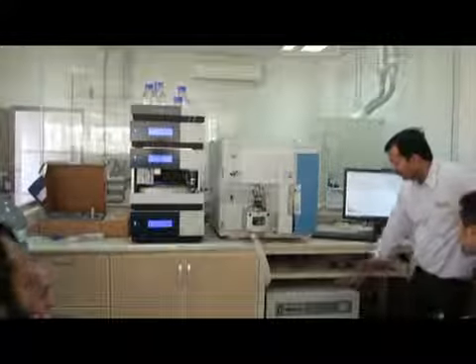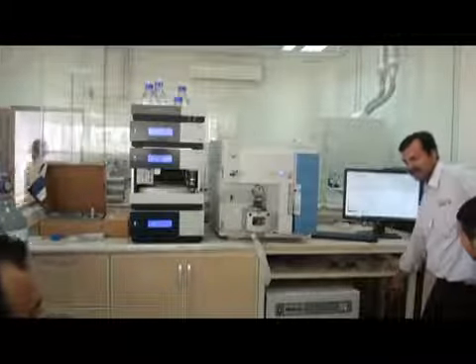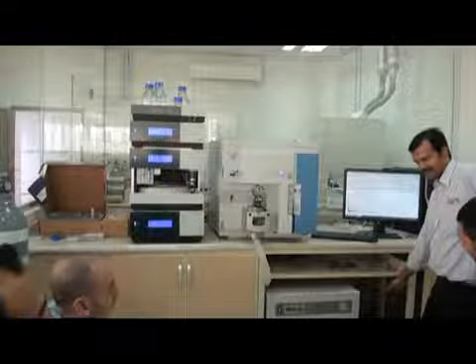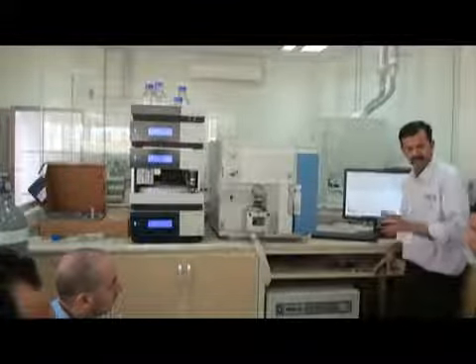Okay. So this nitrogen generator also has a waste. This should be a separate waste. Just keep checking this waste. If this is filled, this will be filled with water. Okay, you have to drain it and then you have to keep it back. But don't mix these wastes, please. Okay, you have to keep them separate.